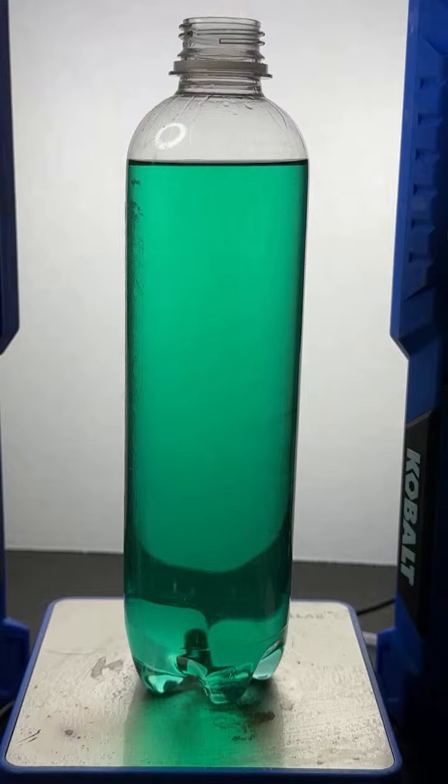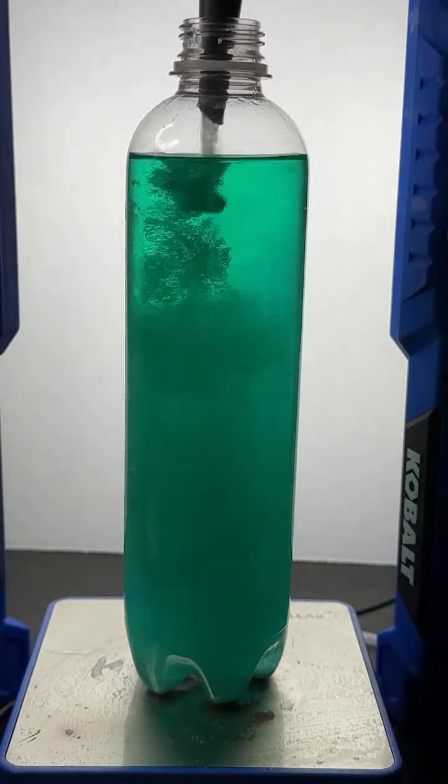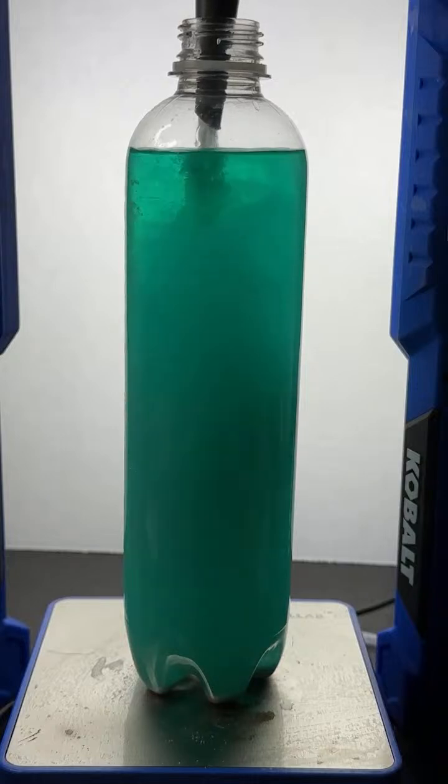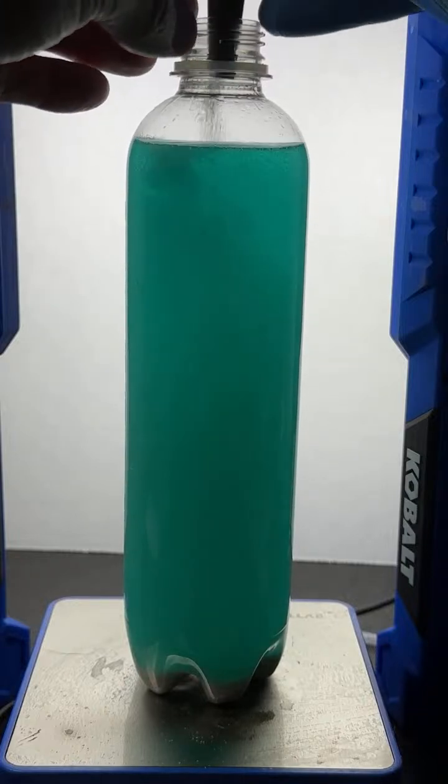Thank you there, El Shingan. Here we go. We're going to add in the white solid. In it goes. Quite a bit to add. In goes the white solid into the green fluid. If you've been watching, you know what the green fluid is. It's a mixture of water and isopropyl alcohol.